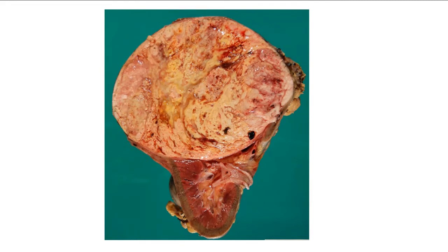So excellent. Okay. What else could we have with the specific lymph nodes? Fabulous. So of course, lymph nodes could be submitted with the nephrectomy, and we'd examine those to see if tumor is there. All right, fabulous. So we can report stage. Stage being a measure of the degree of spread of a tumor, right? So we're looking in these various other tissues to see if the tumor has spread from the kidney elsewhere. What else do we report apart from stage?